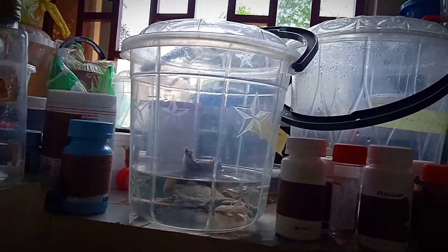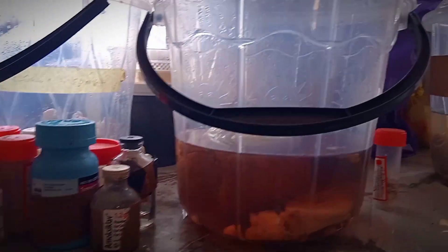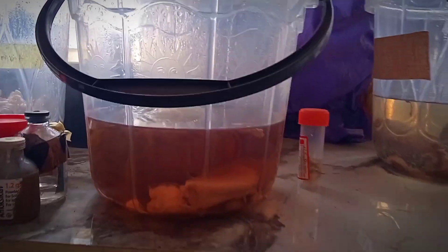This is basically what we do in the histopathology laboratory — processing of tissues. This brings me to the end of today's video on a day in my life as a histopathology intern. I really hope you learned something; you've seen the equipment we use in the laboratory and its histopathology unit.